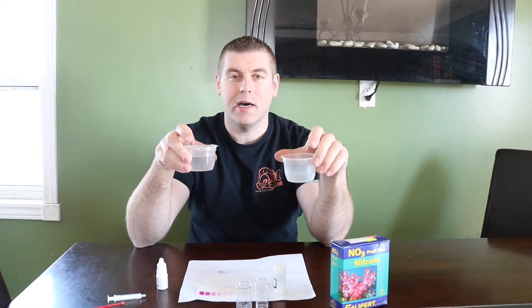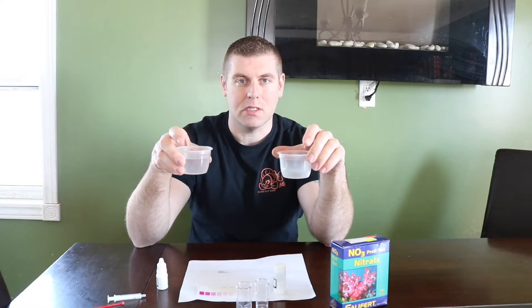So what I'm going to do for you guys today, I have new tank water and I have some old tank water. So I got two samples here. We're going to do two of them at the same time. I'm going to show you what a good sample looks like and what a bad sample looks like.